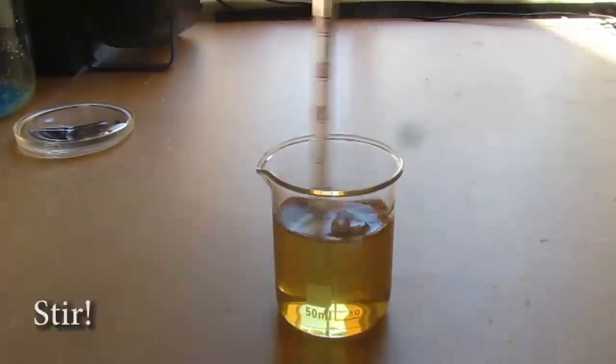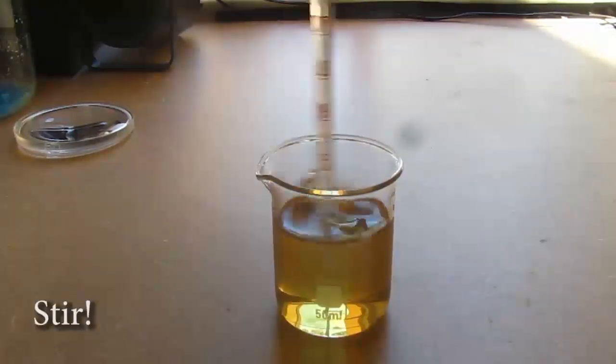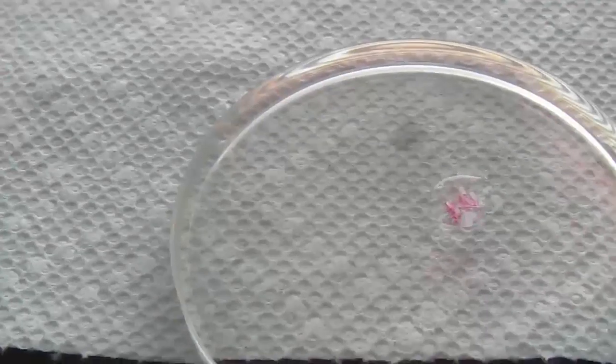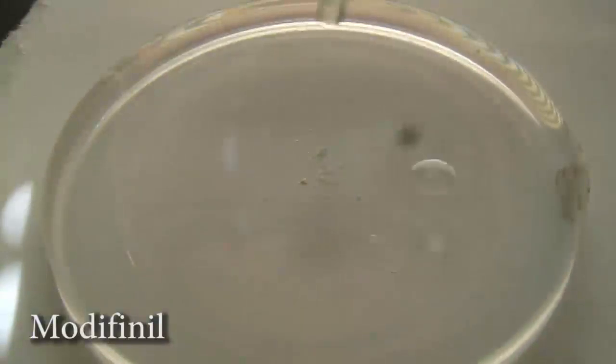Now we stir it up, and I will show you some color changes from common things. This is some aspirin I found around, and after about 20 seconds it turns into a pink color, and then it turns into a deep red color.